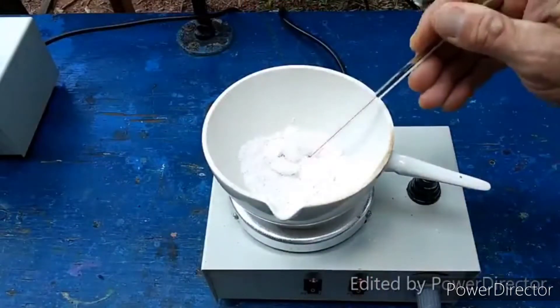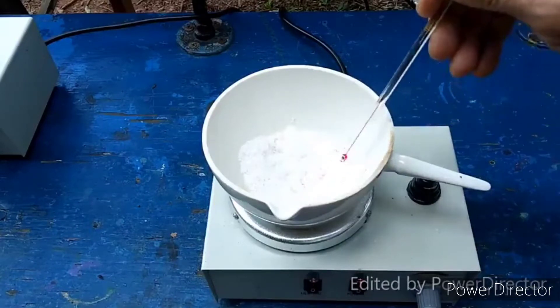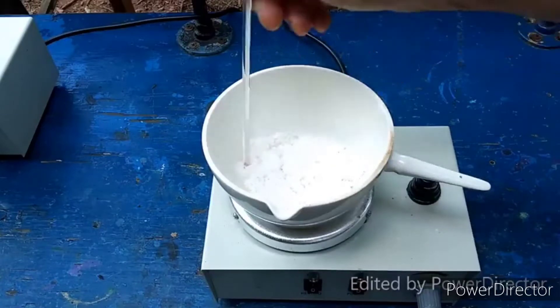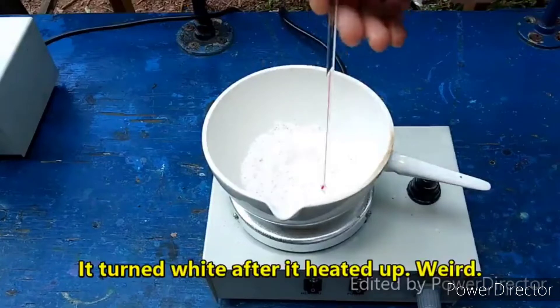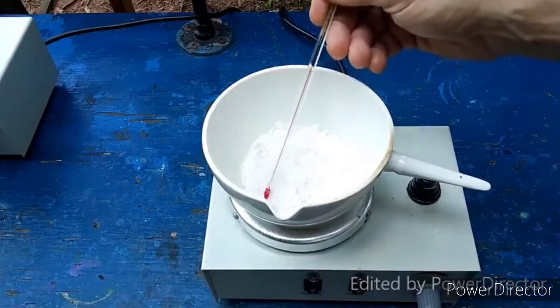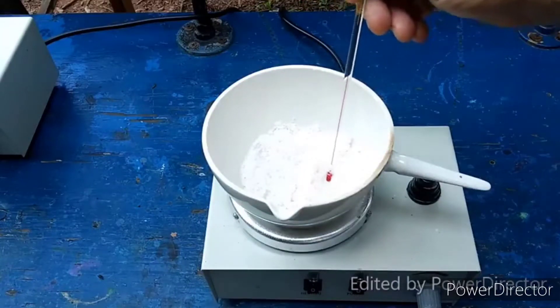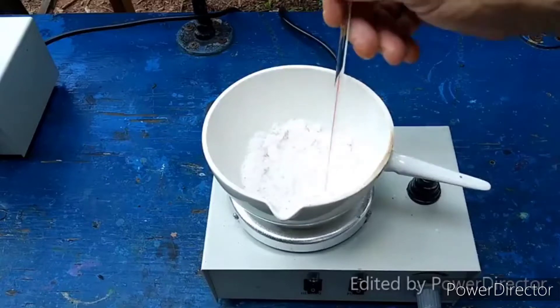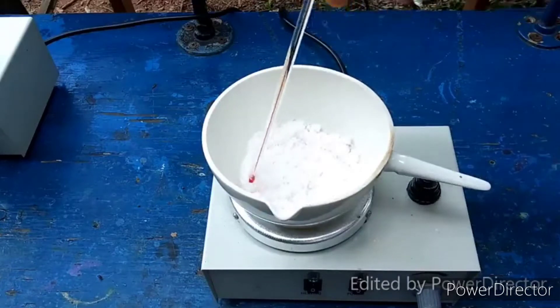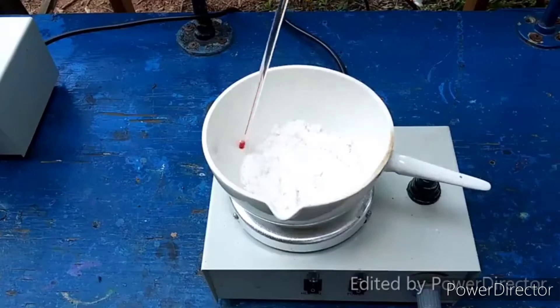What I've got here is 30 grams of ammonium thiocyanate. You can see that it's kind of pinkish for some reason. I have no idea why that would be. This is the first time I've bought from this seller on eBay. Maybe it's supposed to be slightly pinkish? I do not know. Let's hope that it works, since the last two experiments I've tried to film both crashed and burned. I'm just having a bad streak here, y'all.